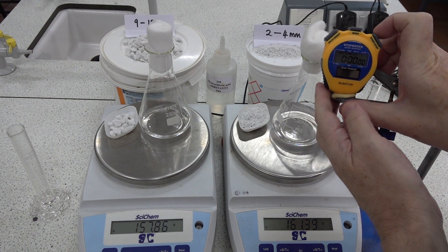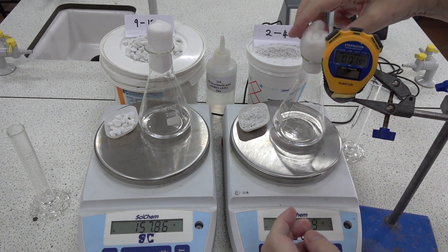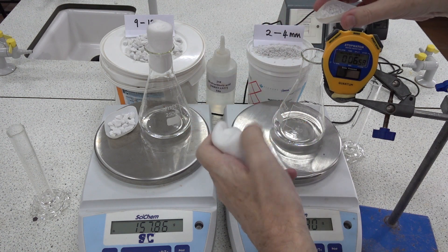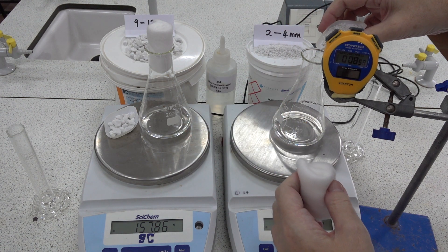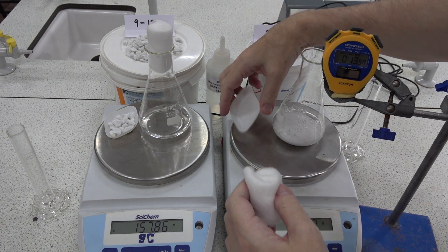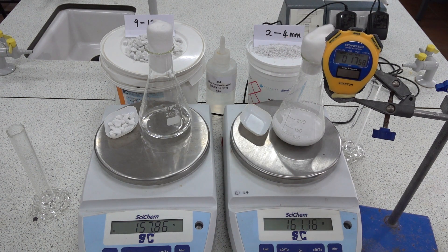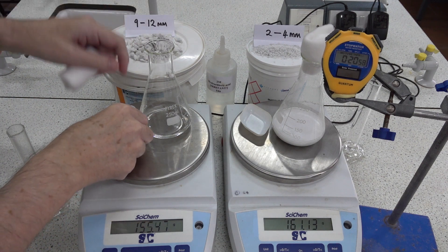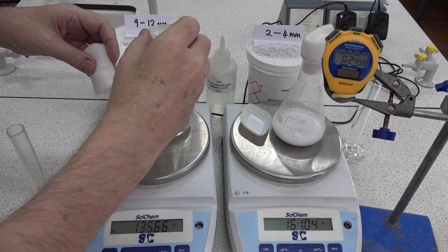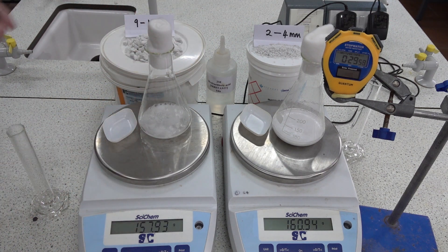So let's start the clock and we'll introduce the small marble chips first at approximately 10 seconds. In they go — there's the reaction, there's the plug. Over to the large chips starting at about 25 seconds. In those chips, into the plug and away we go.